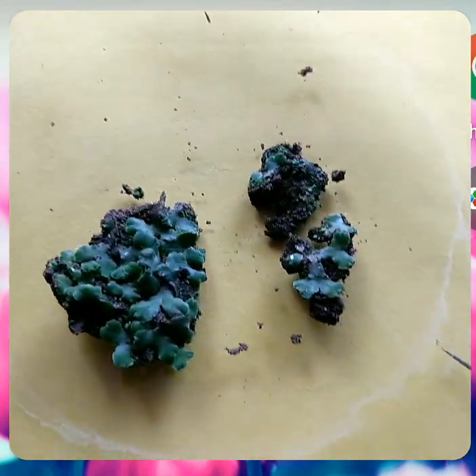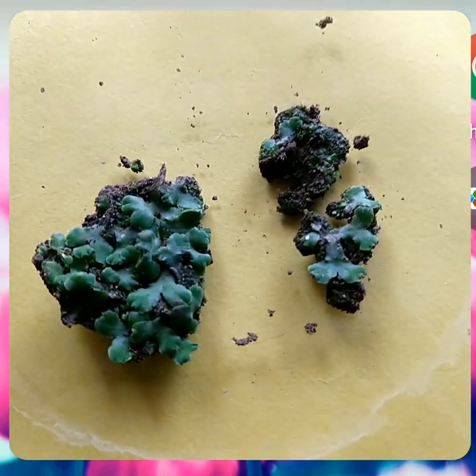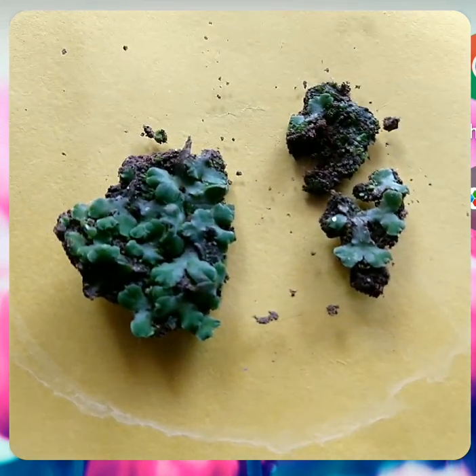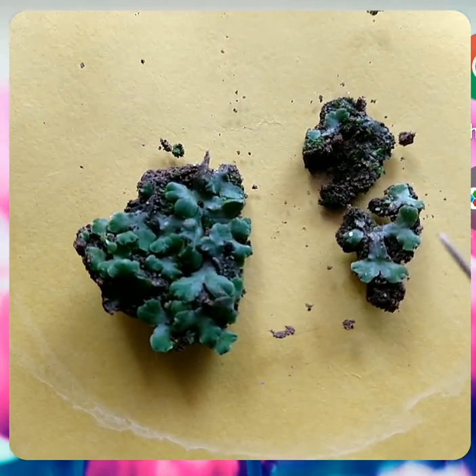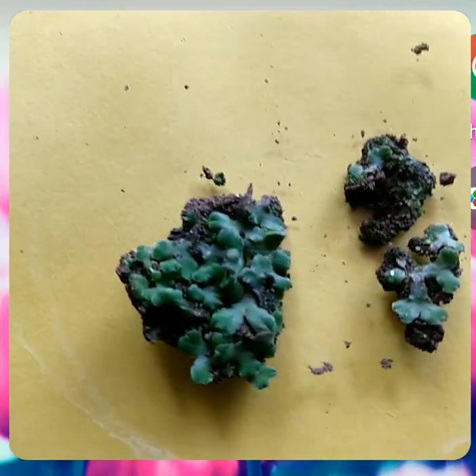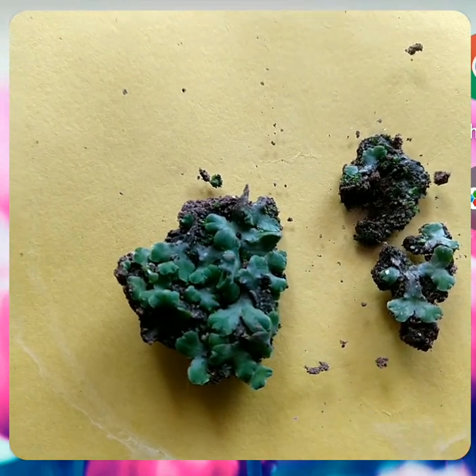The gametophyte is dorsiventrally flattened. Both surfaces are flattened — you can see the dorsal surface is flattened and also the ventral surface. The plant body is called a thallus, which is a simple plant body that cannot be differentiated into root and stem. The first diagnostic character is that the plant body is prostrate, dorsiventrally flattened, and ribbon-like. This thallus undergoes division and forms a rosette-like appearance — that is, it forms a circle by repeated dichotomous division.